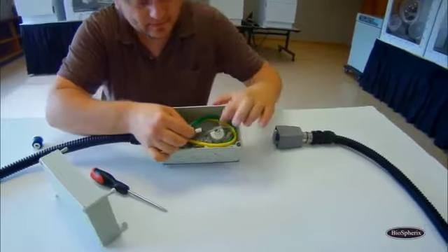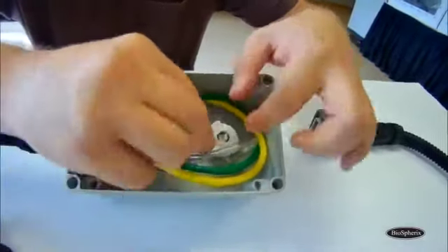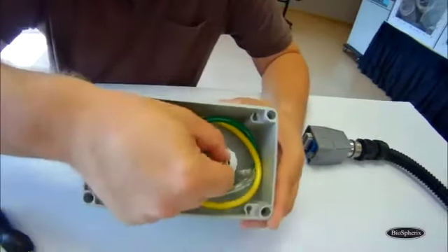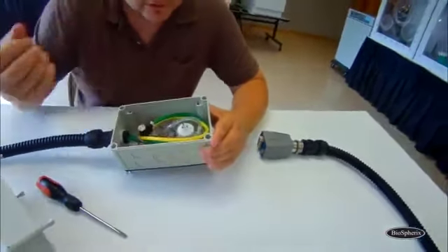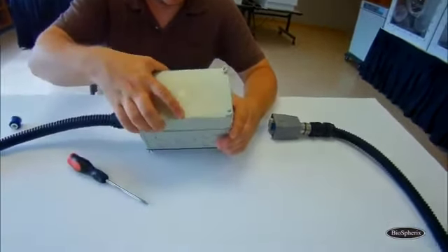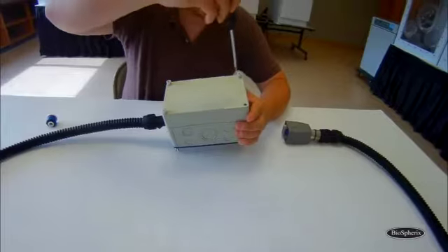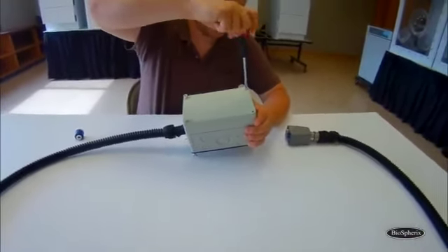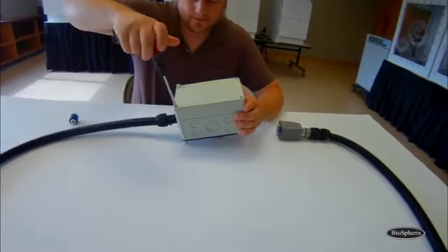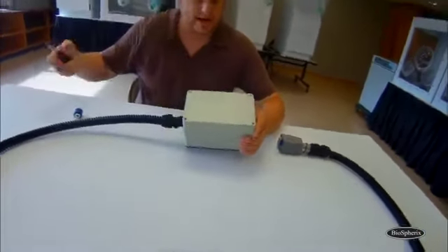I take the clip. Here's that little white piece that holds it in, so I point the side that has the teeth on it and just push it in. It kind of clicks. You can see it and feel it fit snugly in there. So it's screwed in, clipped in, so now it has the electric connection, and that's really all there is to it. Now we just put the cover back on and tighten these down. And it's all set to be used again.